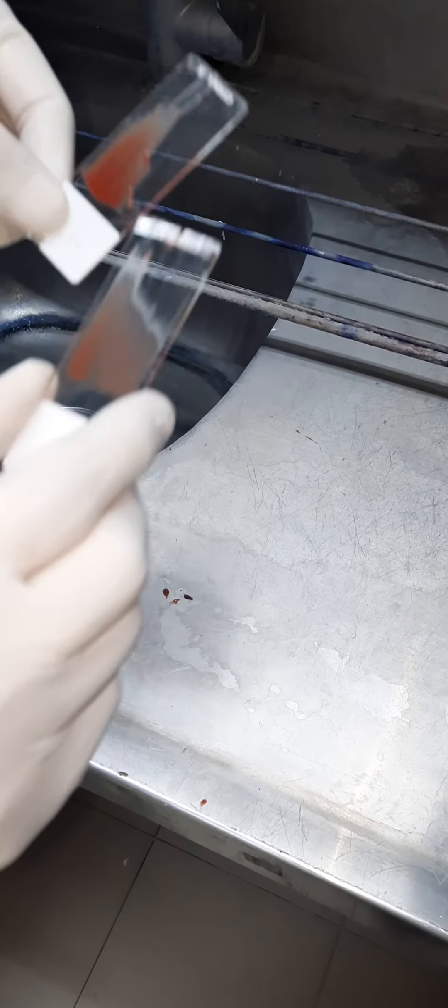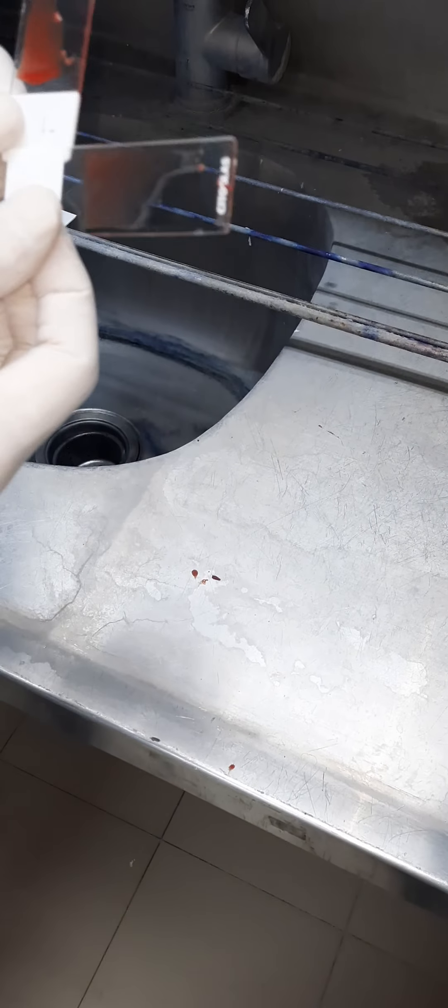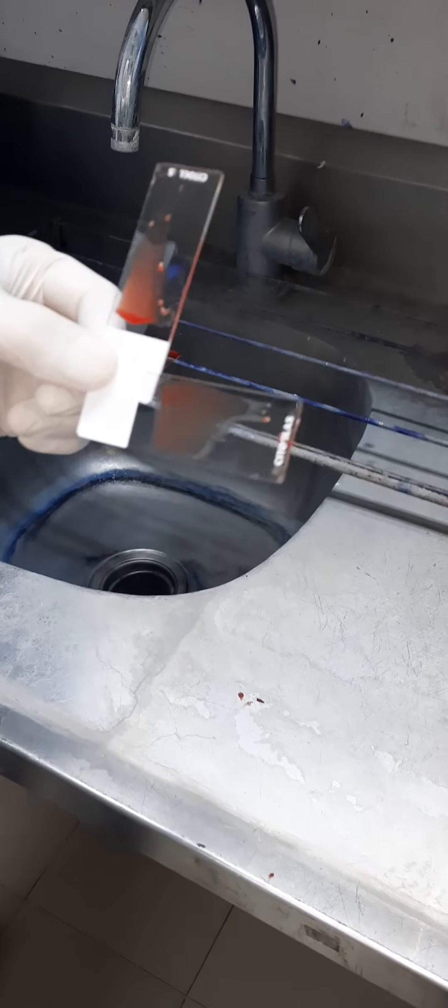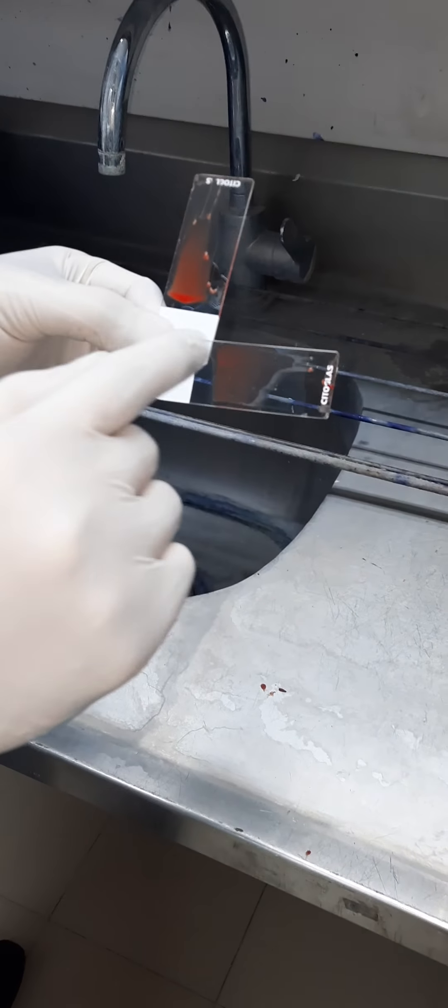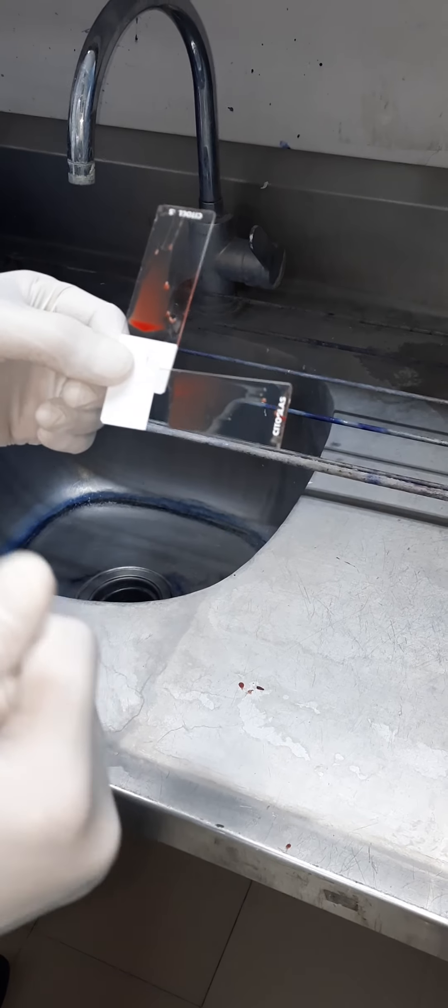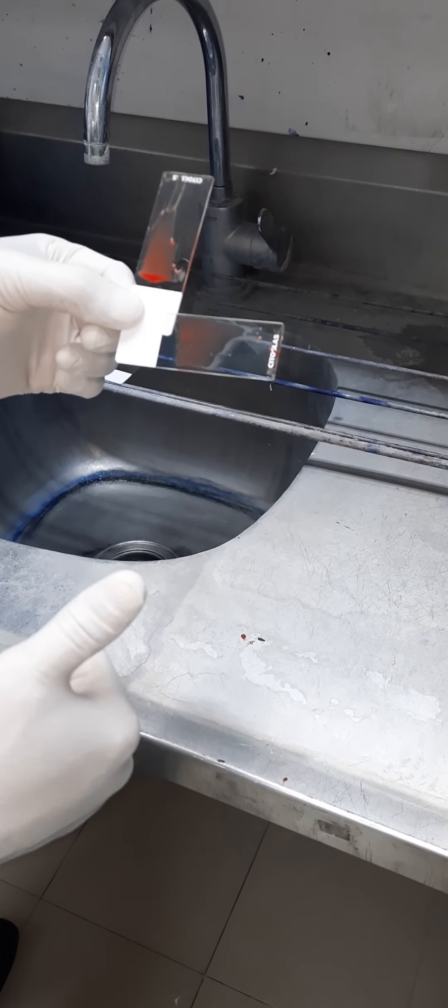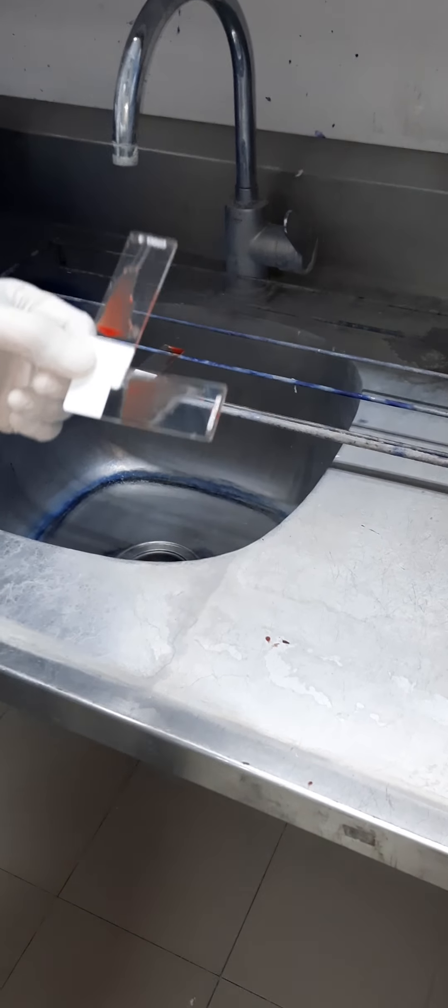Thank you very much. This is the ideal sample of bone marrow spread for proper evaluation of morphological as well as cellularity of the bone marrow. Thank you.